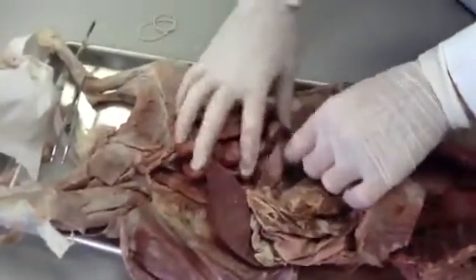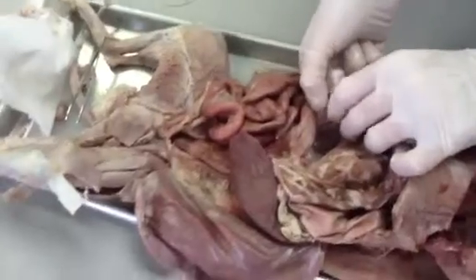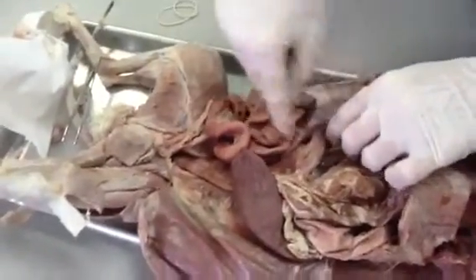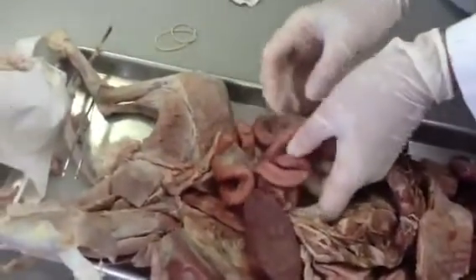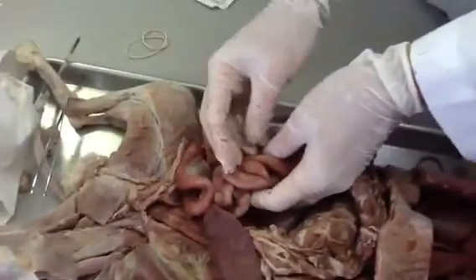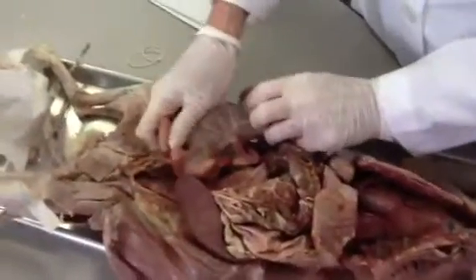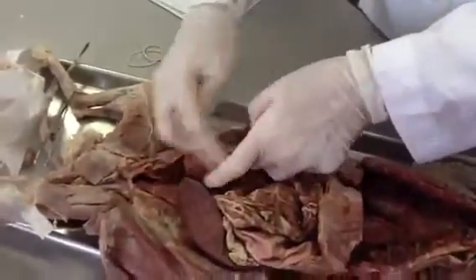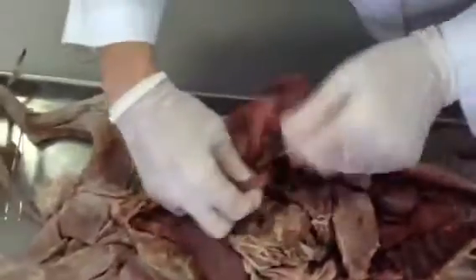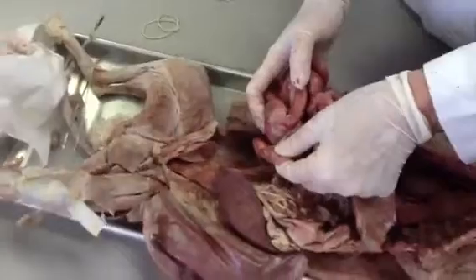The intestine has three parts. The most proximal end is the duodenum. That's where digestion is going to begin. It's going to continue to move down into the jejunum, where most absorption takes place. This is where all the nutrients and vitamins and minerals are being absorbed into the bloodstream via the mesentery. You can see the tissue that holds all the blood vessels. It's going to continue to move down to the very end of the small intestine before it goes into the large intestine, right here, into the ileum, where absorption of the nutrients is going to end.